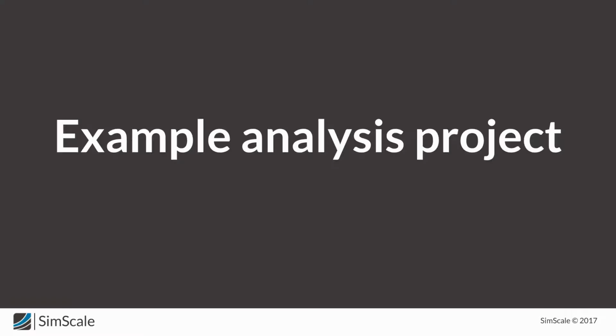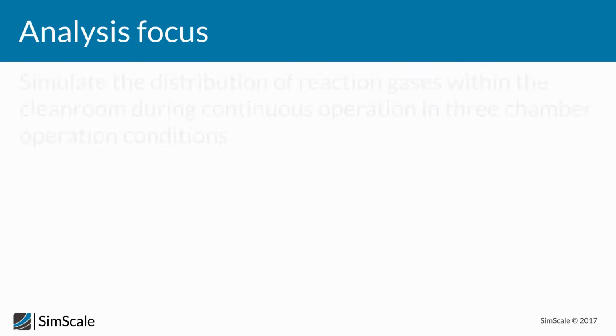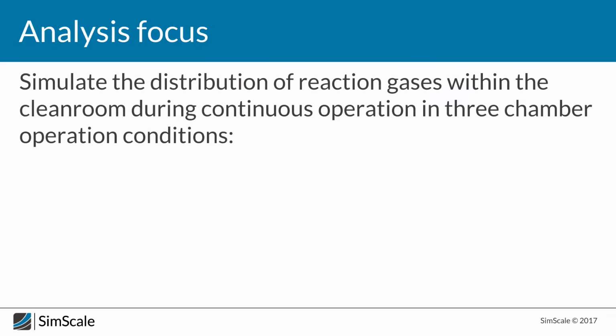Let's take a look at an example analysis project that we'll be talking about, and so enough of the theory, and we'll move to the practical example that I have prepared for you. In this case, we will try to make a comparison of ventilation performance for a multi-purpose chamber in a small clean room looking like this. First, we'll talk about the CAD design and the way to prepare it on Onshape, and after that, we will move to the simulation itself. So the first focus will be to simulate the distribution of the reaction gases.